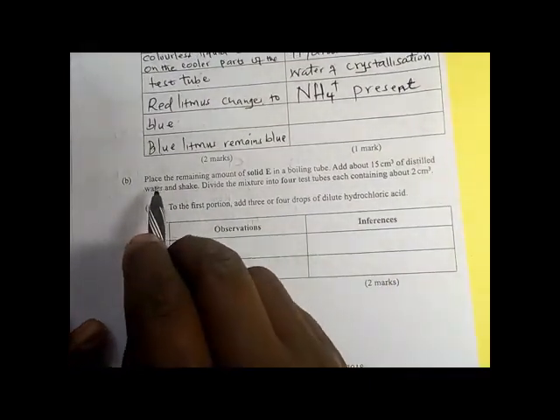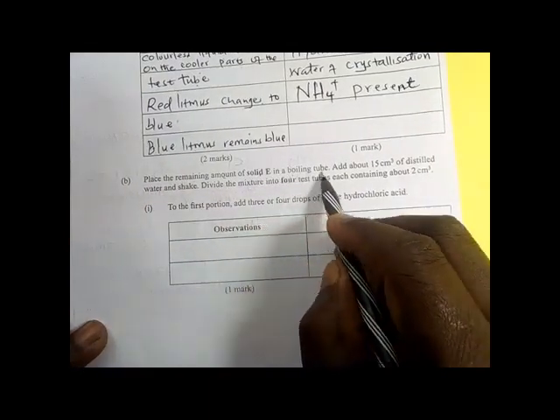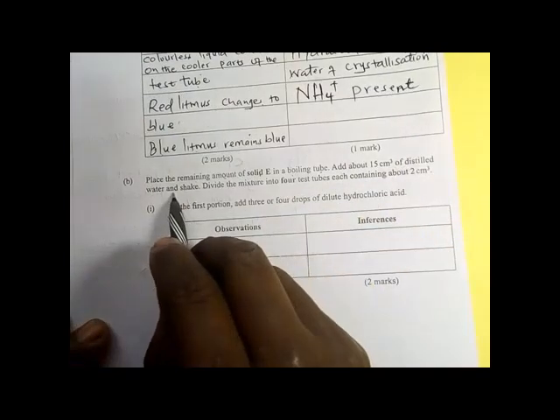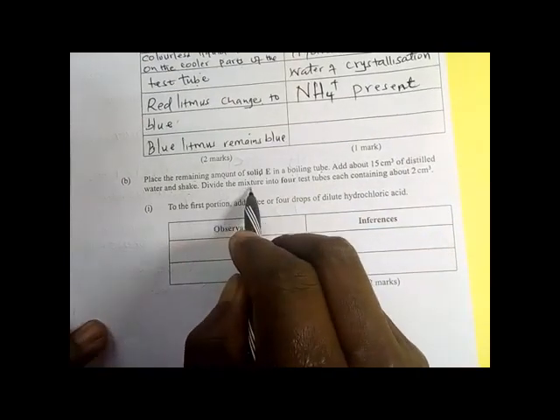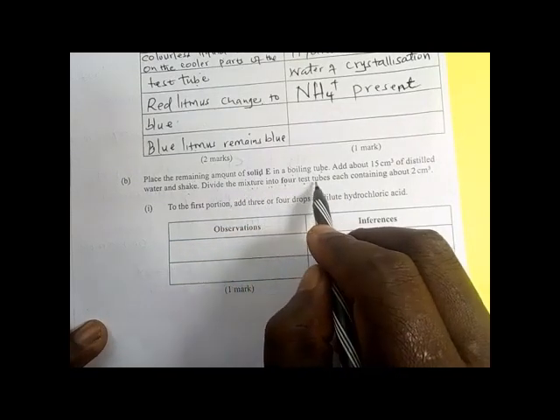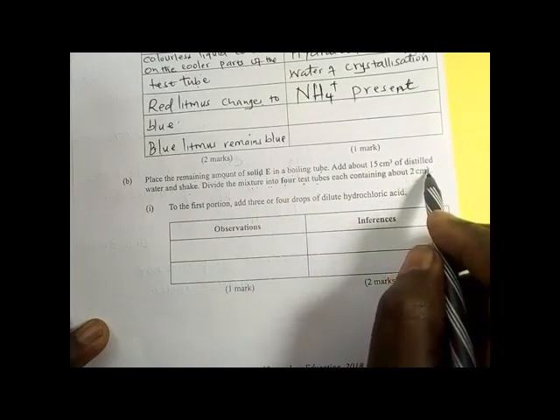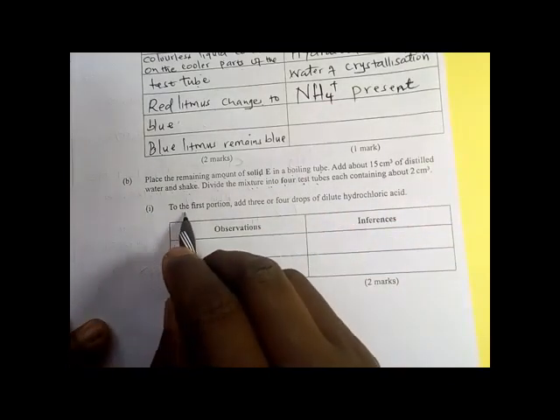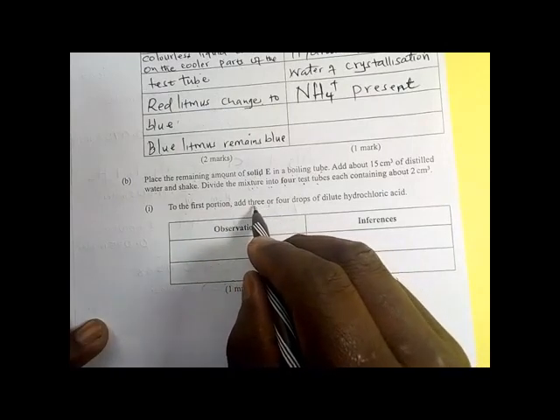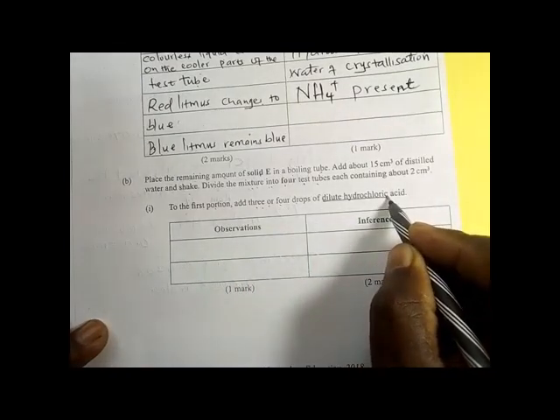Now place the remaining amount of the salt in a boiling tube, add about 15 cm³ of distilled water and shake. Divide the mixture into four test tubes, each containing about 2 cm³ of the solution. To the first portion, add three or four drops of dilute hydrochloric acid.